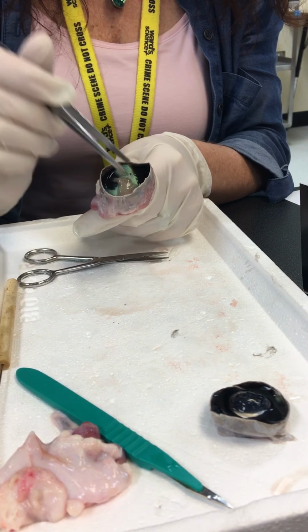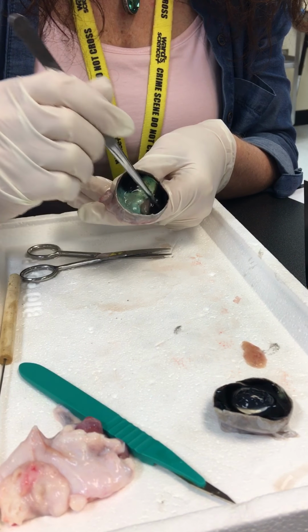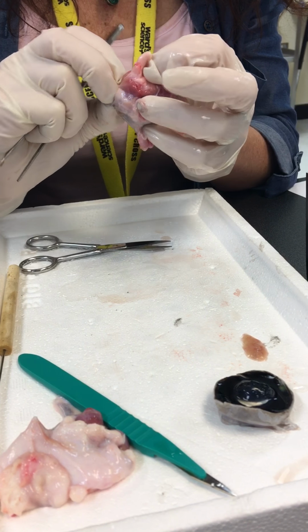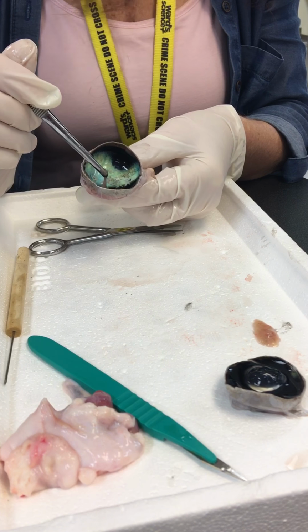Oops, I'm getting some of the retina out of there. Still got a little bit of retina back here. This part that's attached is called the optic disc. Now, if you look on the very opposite side of that, what's the structure? Yeah, so it's attached right there. It goes right to your optic nerve. So on this spot, this optic disc, no light can get in, or it doesn't perceive light. That is your blind spot. That's where your retina attaches.